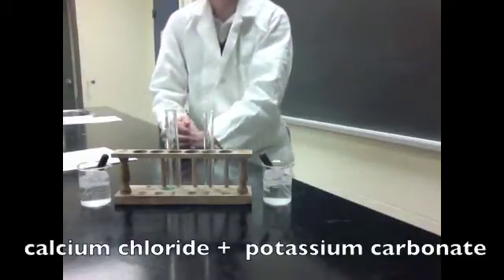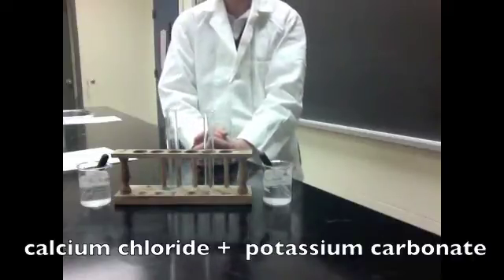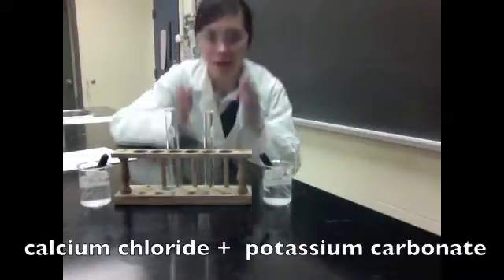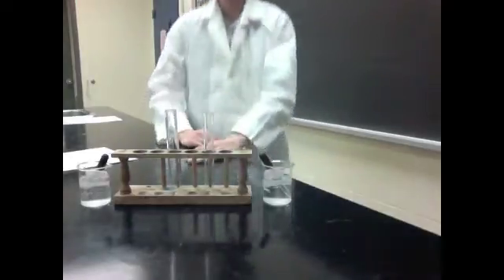Hello class. Today we're going to be observing the reaction between calcium chloride and potassium carbonate. Make sure that you have your goggles on, and girls or guys, make sure that you tie your hair up.